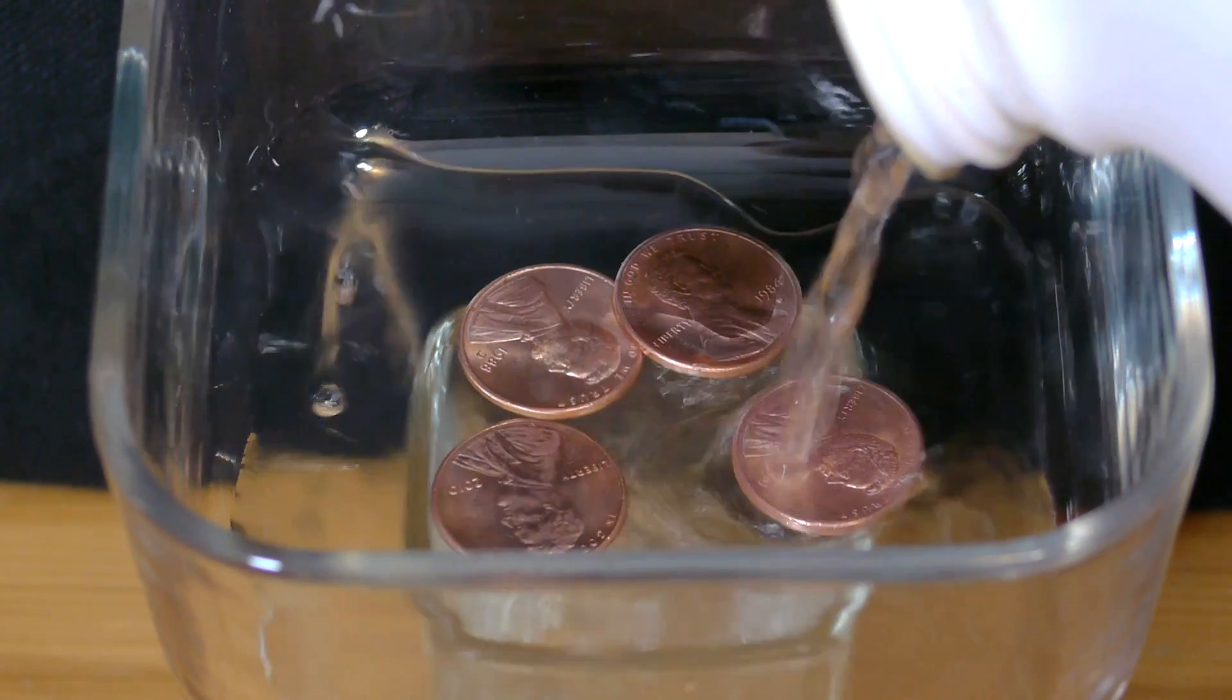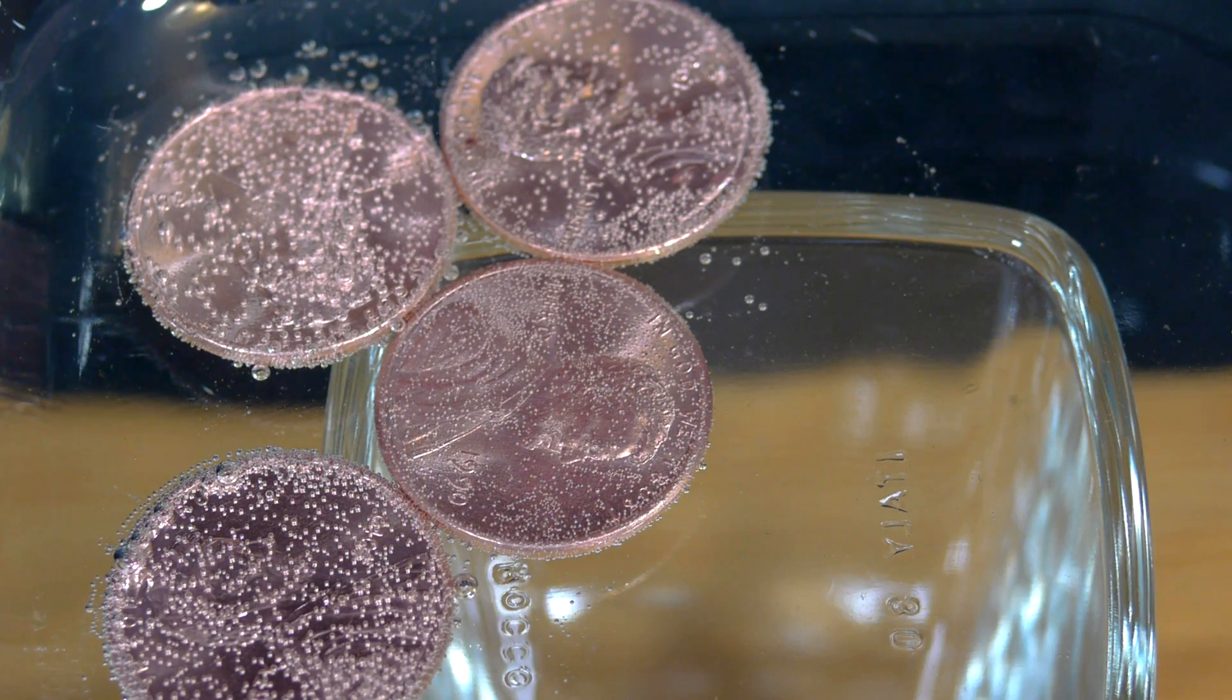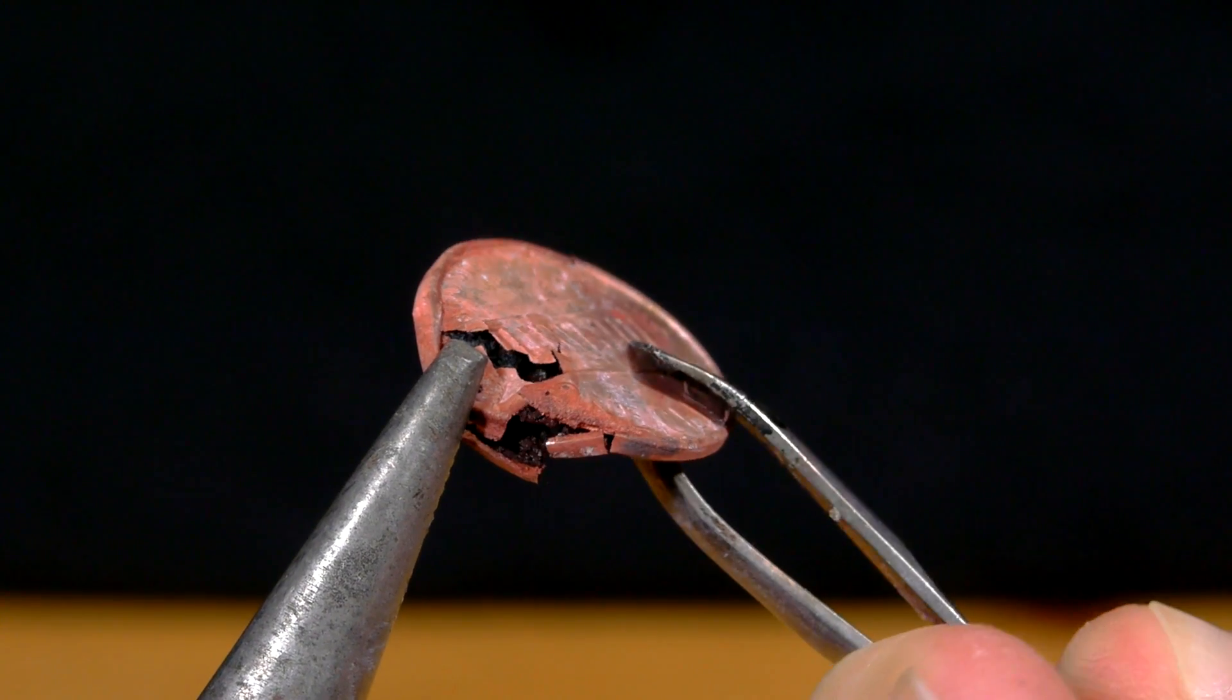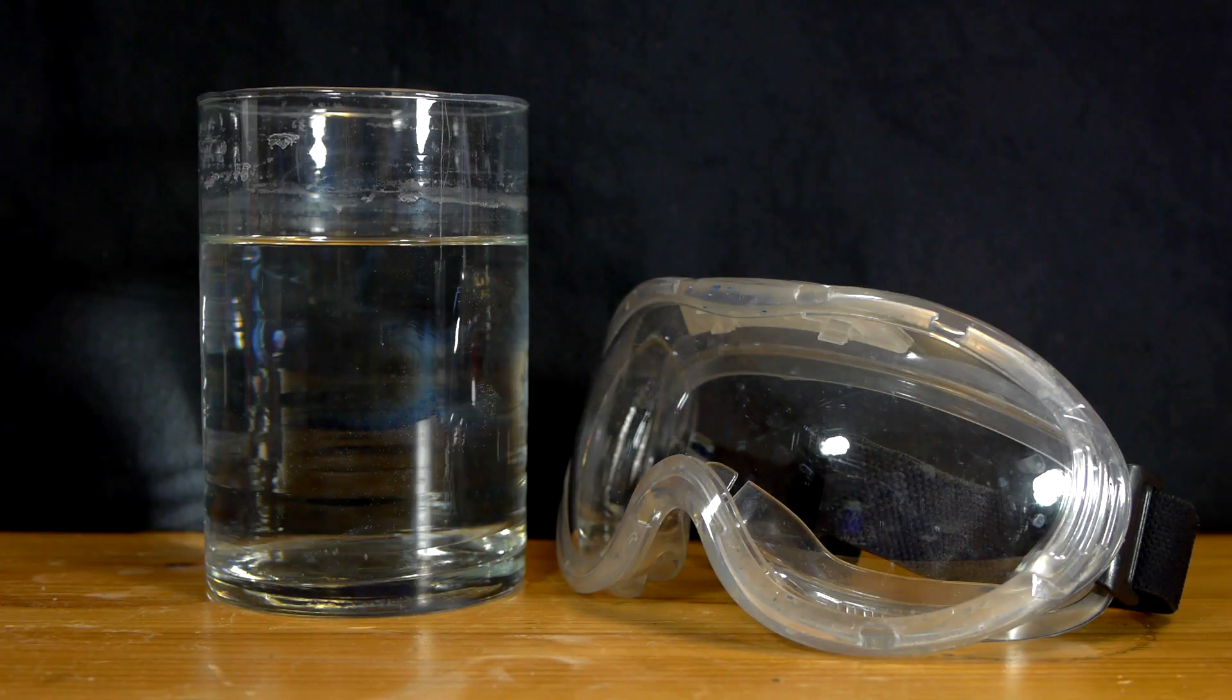This is an acid that is strong enough to cause burns, so handling it at all is something that should only be done by responsible adults. Whenever working with a strong acid, safety goggles for eye protection are absolutely essential.